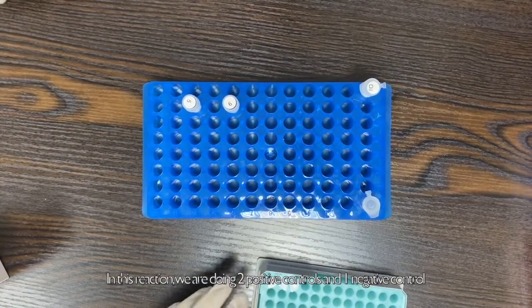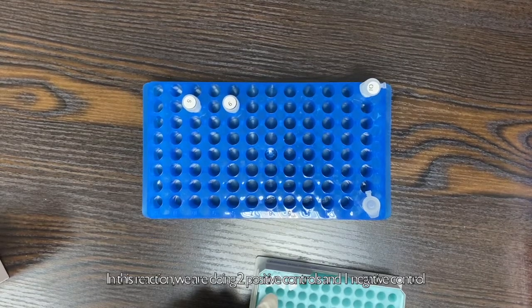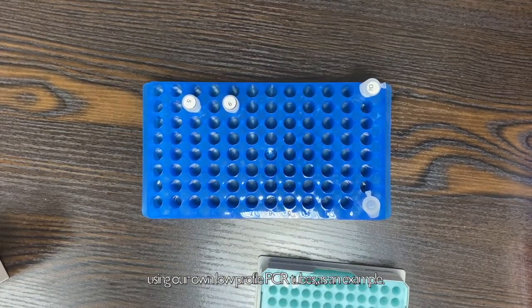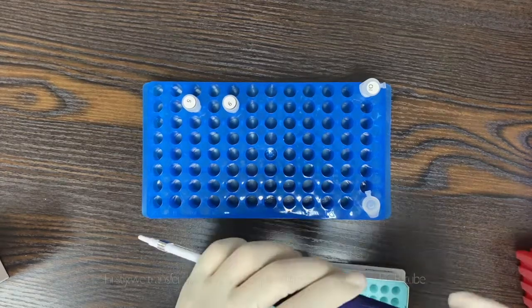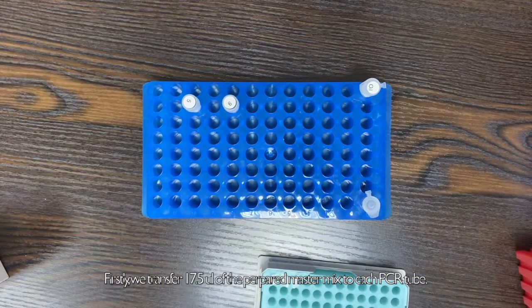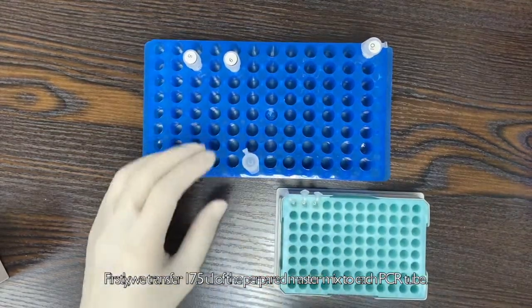In this reaction, we are doing 2 positive controls and 1 negative control using our own low-profile PCR tubes as an example. Firstly, we transfer 17.5 µl of the prepared master mix to each PCR tube.